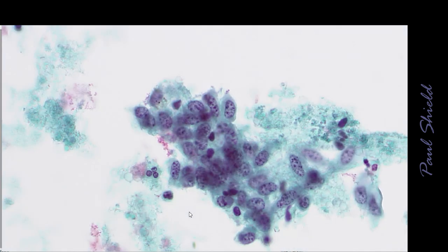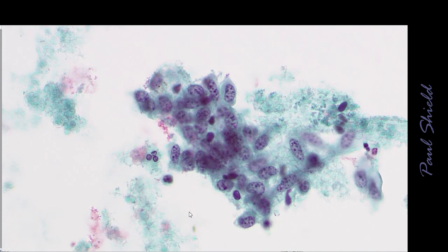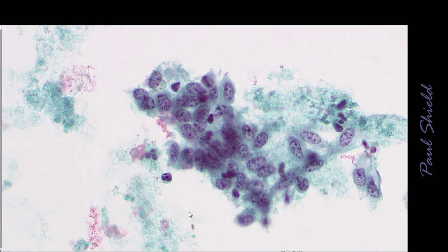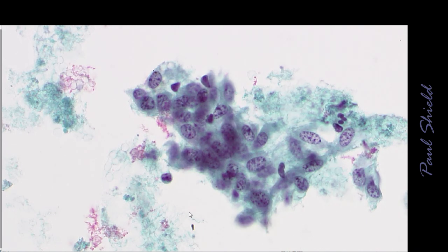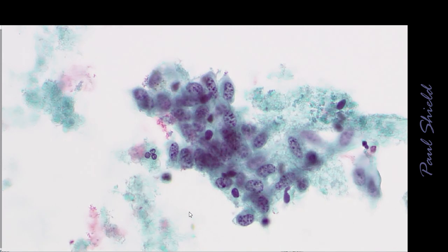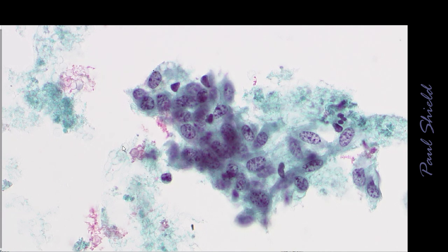Here you can see the really loose group of endometrial cells. Notice these are a little more oval or elongate shaped. Notice the chromatin on these, which we would call stippled. As well as having a fine background to the chromatin, you can see dots of chromatinic material as well, like someone's shaded it in with dots. Notice the nuclei are overlapping here, and the cytoplasm has no distinct borders to it at all.